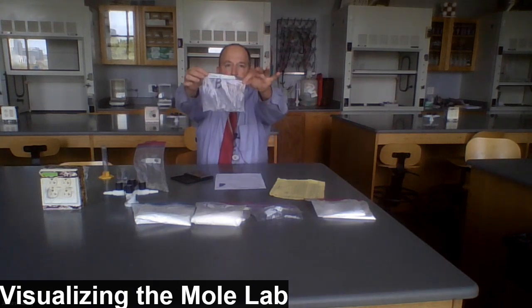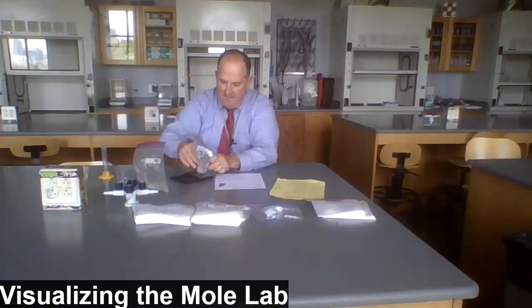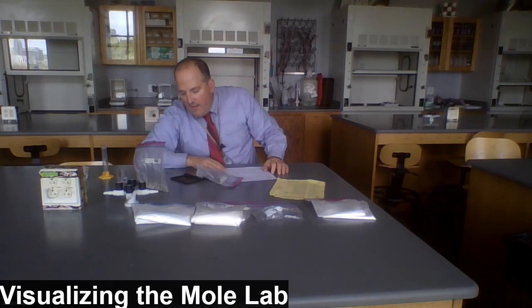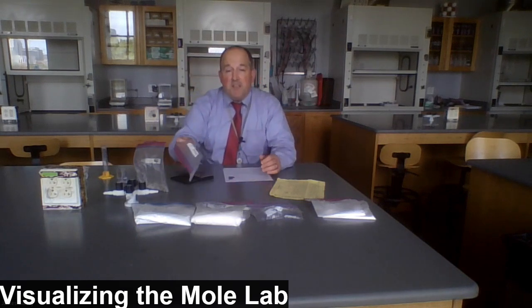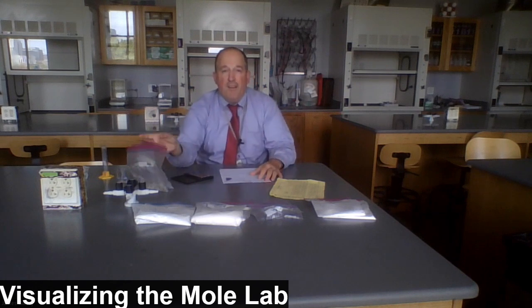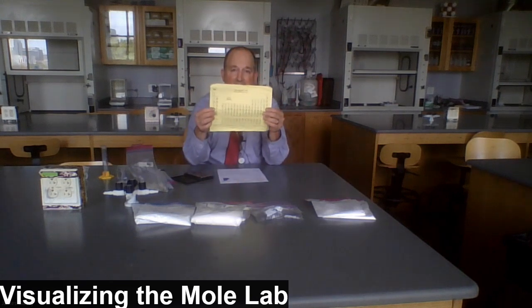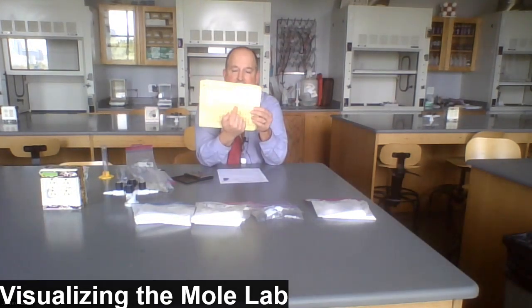Here's the other grayish metal in a plastic bag. I'm going to set it on the scale, and I get a reading of 69-ish, 68.9. So let's call it 68.9. If I subtract the mass of the bag itself, which is 5 grams, from 68.9, I get 63.9. Well, students, zinc has an atomic weight that's pretty close to 63.9.